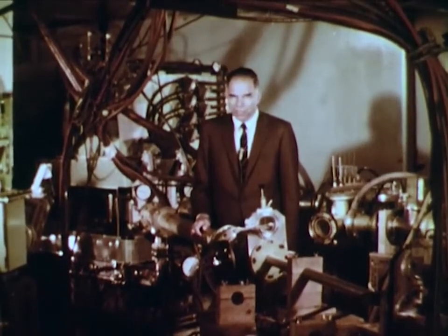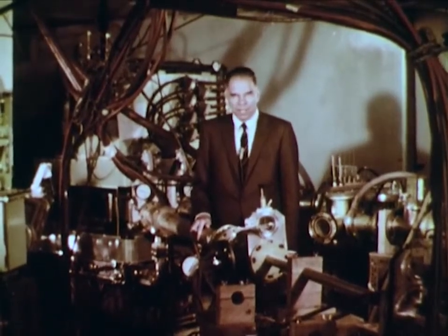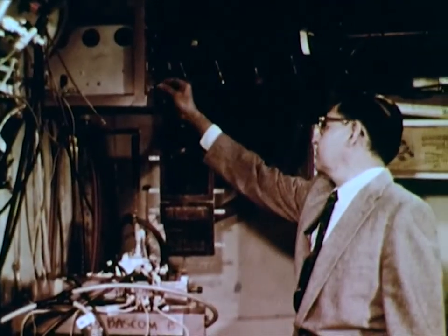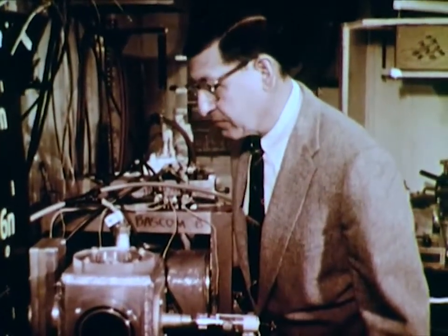We can further appreciate the precision of these ion exchange experiments if we realize that the original discovery experiments produced such minute quantities of the new elements that they were invisible. In fact, with element 101, only five atoms of the new element were identified in the 101 elution position. Elements with atomic numbers higher than 101 are produced in this machine, which is called HILAC or heavy ion linear accelerator. Here is Mr. Albert Ghiorso, who performed the key detection experiments in the discovery of elements 102 and 103, which were synthesized in this instrument.